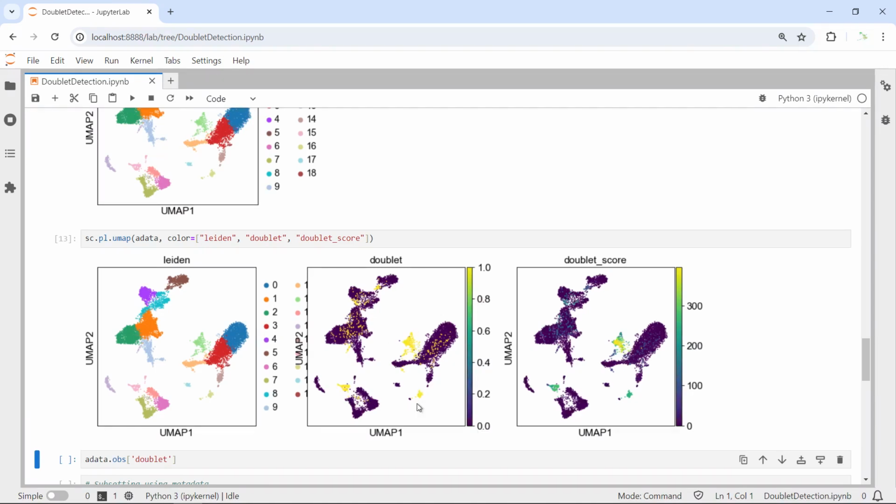Those cell clusters could be heterogeneous doublet. Other doublet you can see they mixed very well with singlets. So those doublet could be homogeneous doublet because they express similar genes as the singlets. You can see these three clusters. If you don't remove it, it will be difficult for you to label the cell clusters correctly and also will affect your downstream data analysis.